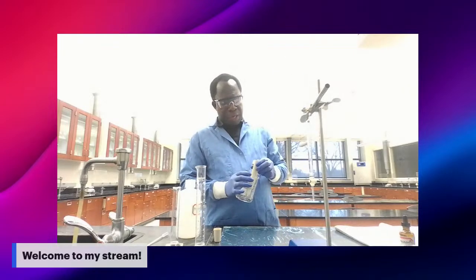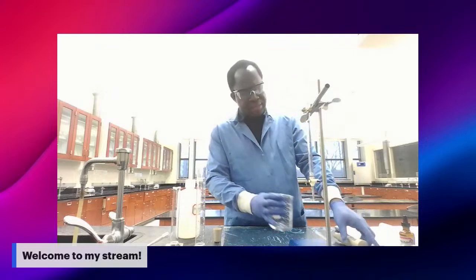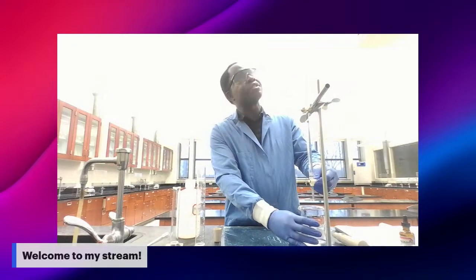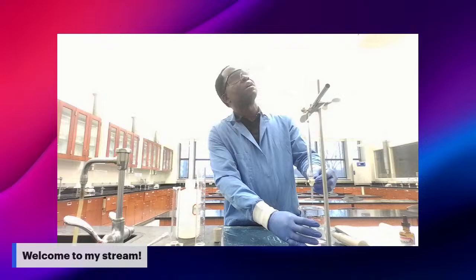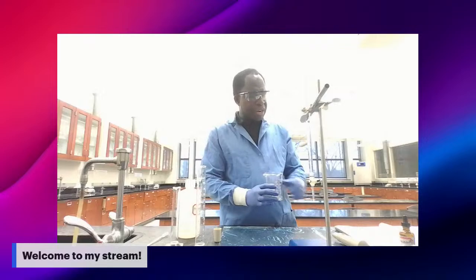Now we're going to move to add another increment. So now I add 2 milliliters.